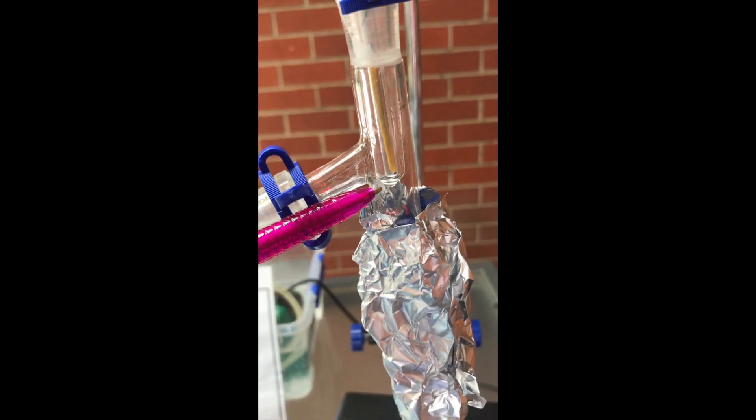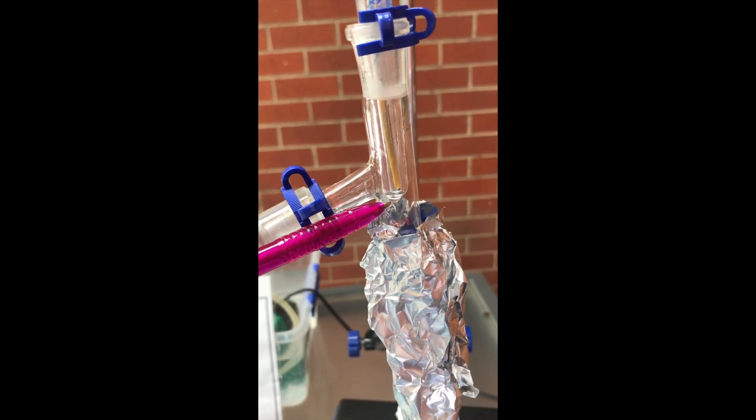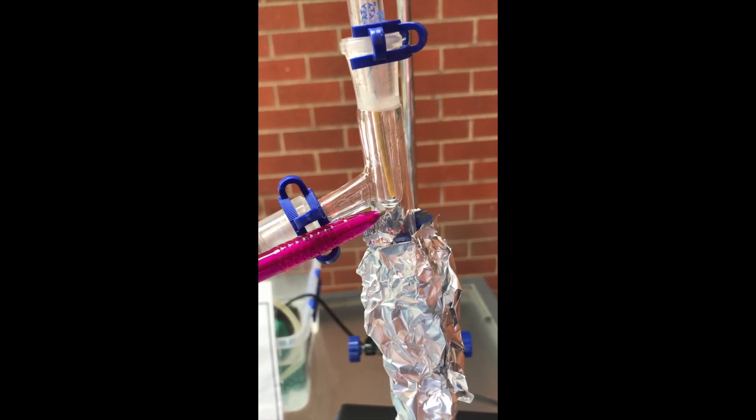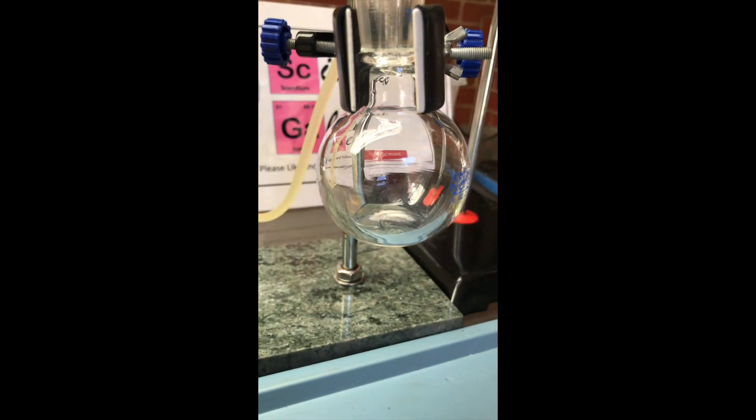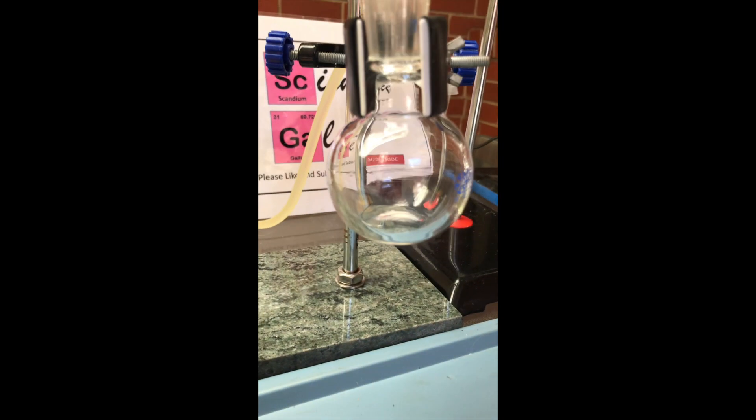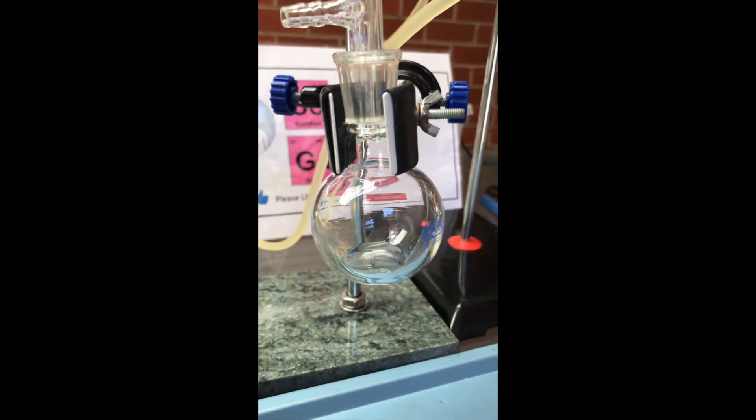It was at 52 degrees celsius when the drops were finally reaching the thermometer. It was very exciting to see the first few drops of the purified acetone come through. Thankfully the rotten egg smell did not come across as well.